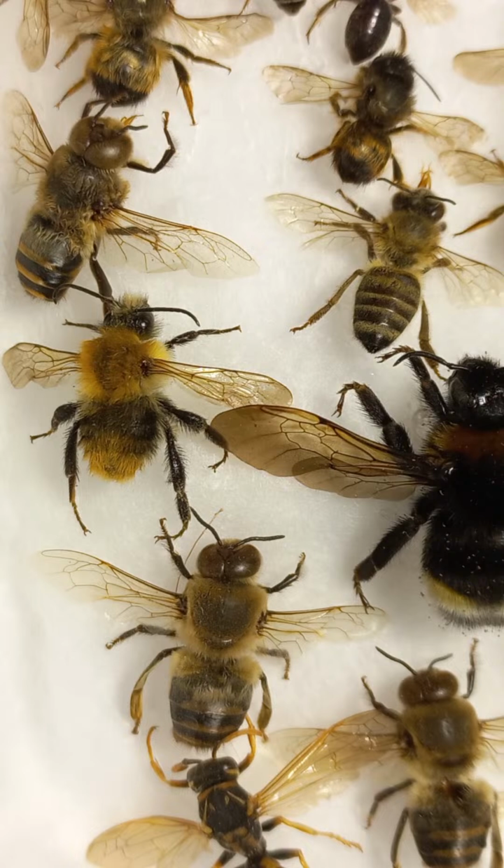The abdomen is also perforated with 7 more pairs of spiracles. The honeybee sting is only for the female castes, and the sting is located at the tip of the abdomen. There are special wax-secreting glands located on the underside of the abdomen. And the scent gland is also an important abdominal gland of worker honeybees.